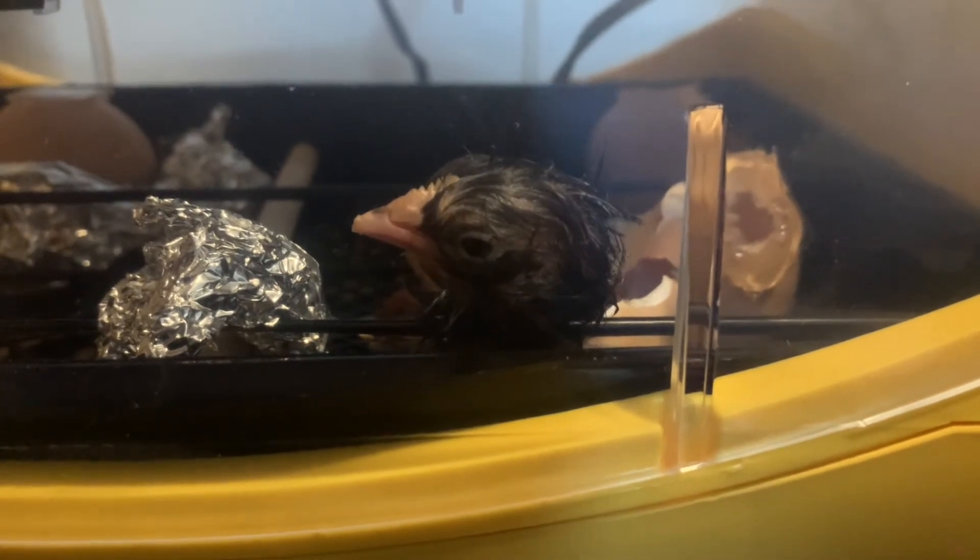It is not the most successful way for hatching chicks obviously, and I don't turn these eggs while they're in the incubator — they just sit there. If you have things clean you should have a fairly decent success rate, maybe 50%, but if things are not clean it's just not going to work out. You have to be extremely clean and careful to not get contamination in there.